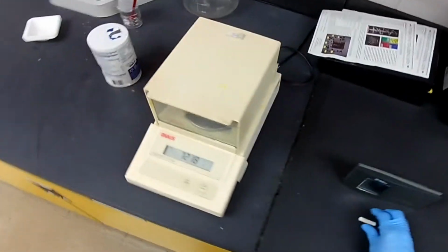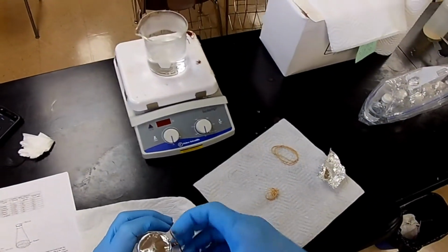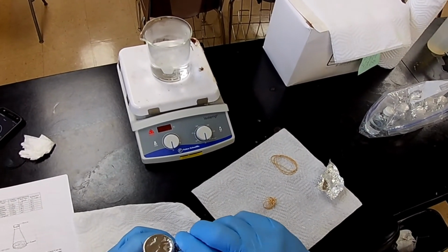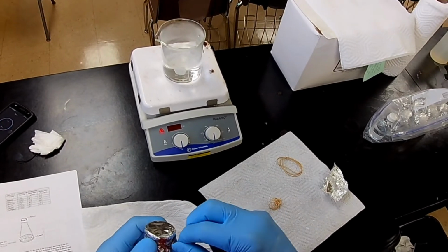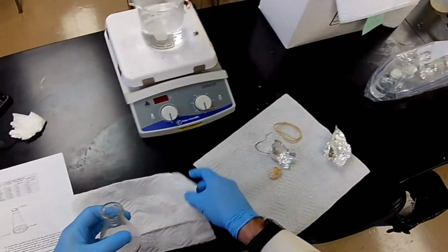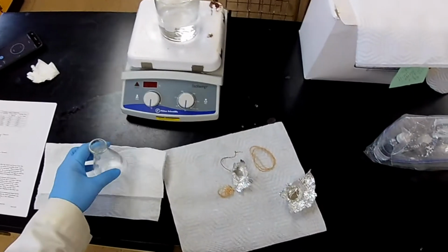Right now we need to get the volume of the flask. So to do that, we have to take this contraption apart. Like this. Like that. And it needs to be cleaned. That's a pretty volatile liquid. I think if I just sit it there, it'll evaporate on its own.